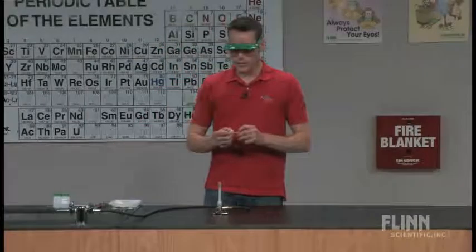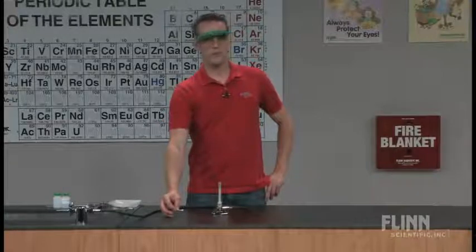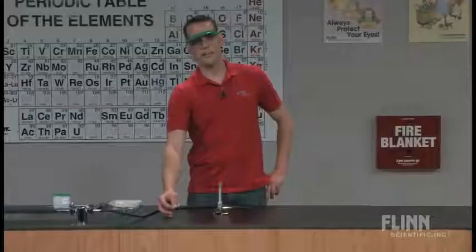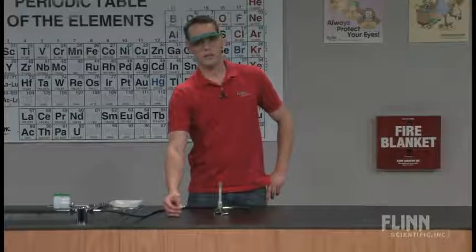I found a way a little bit later on that you just use a regular Q-tip. The Q-tip you can moisten with a little bit of water, dip it into whatever salt you choose, and then hold it over top of the Bunsen burner. And then you can throw it away when you're done. It's a very clean and efficient way of doing a flame test.